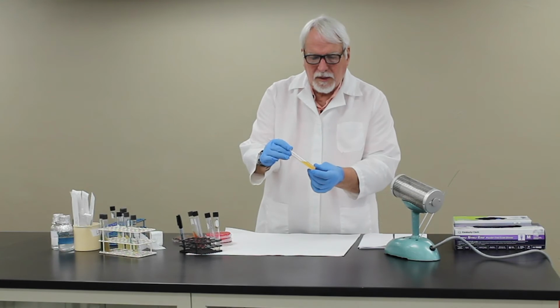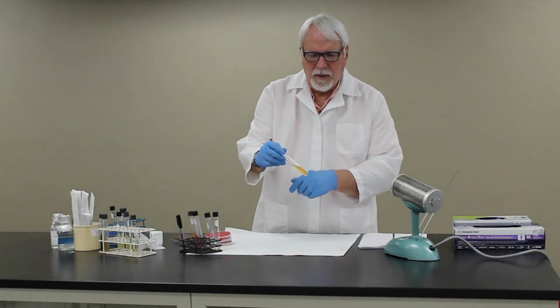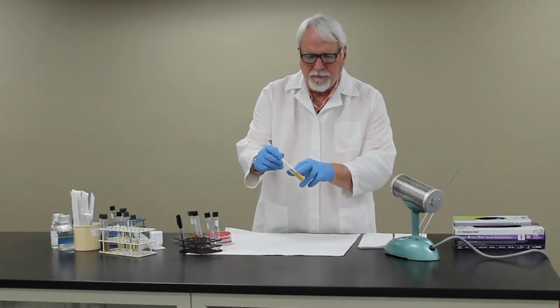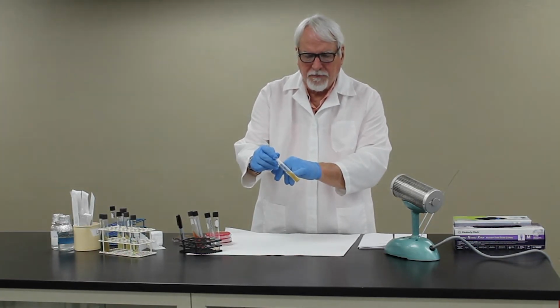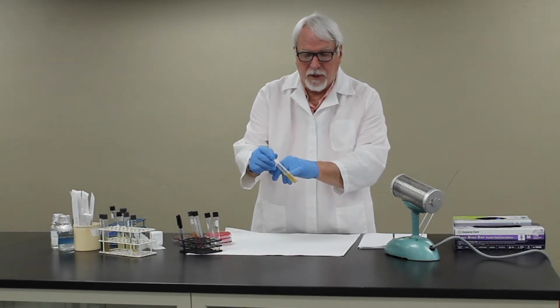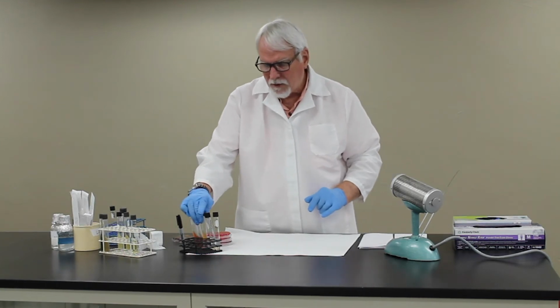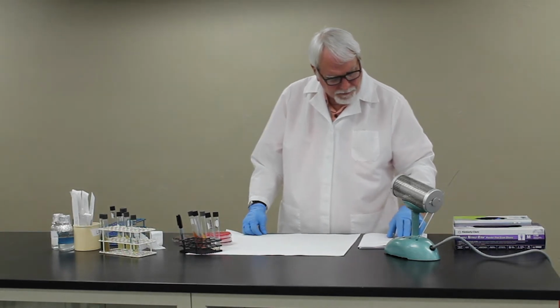The urea slant is going to be a test for urease production. You will streak the slant only, and if you get a bright pink coloration on the slant within 1 hour, that's indicative of a very fast reaction of urease production. But we'll also look at it in 24 hours to see if the whole tube has turned pink. So urease is really an important test with this group as well.